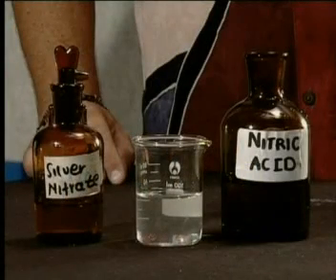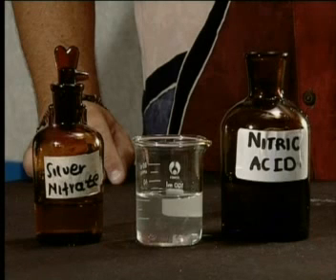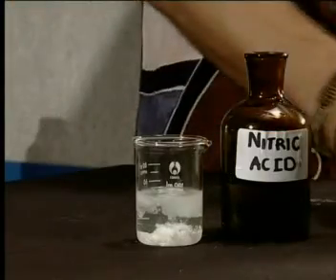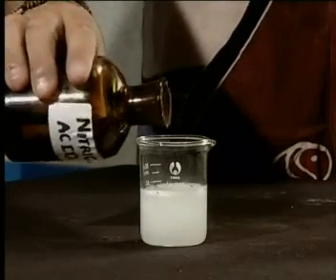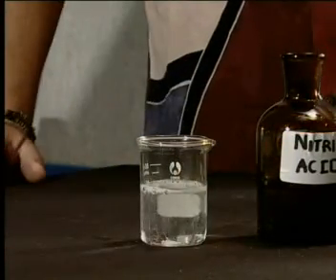In this beaker, we have a solution of a sodium salt. The anion is unknown. Let's do the halide test to see if a halide is present. We add a drop of silver nitrate to the solution — and what do you see? A white precipitate. Now add a few drops of nitric acid. Look at what happens: the precipitate fizzes and produces bubbles and then dissolves. So we can conclude that a chloride was not present. What was the precipitate that was formed, and why did it dissolve in the acid? The answer to these questions lies in the solubility rules from the previous lesson.